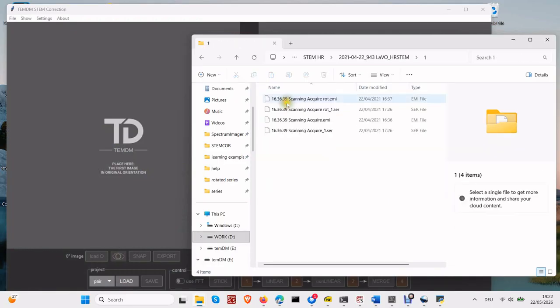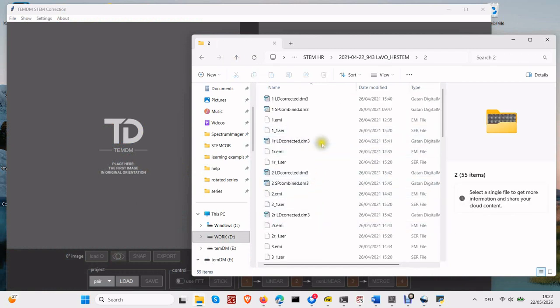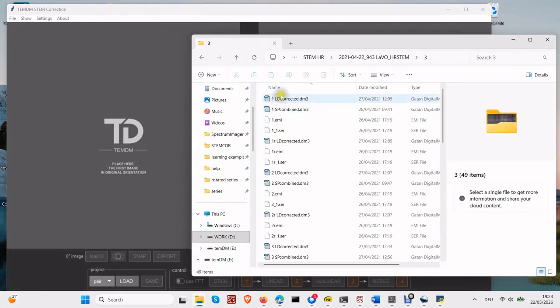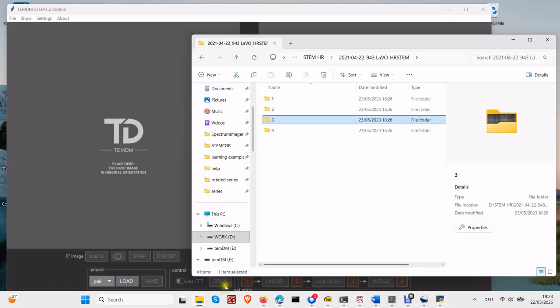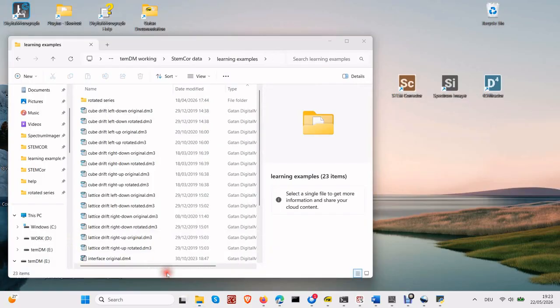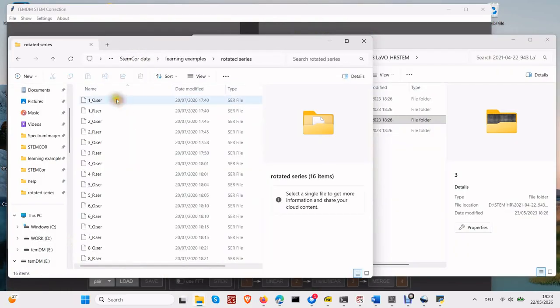It can be quite tedious to load 10 image pairs into STEM Corrector, align them, process them, and then inspect each one to decide whether it is good or not. However, STEM Corrector is not able to automatically classify all acquired images into corresponding pairs. Therefore, you need to help define unambiguously which images are scanned in the normal direction and which are scanned in the rotated direction. The easiest way to do this is to name the files in a standard way.